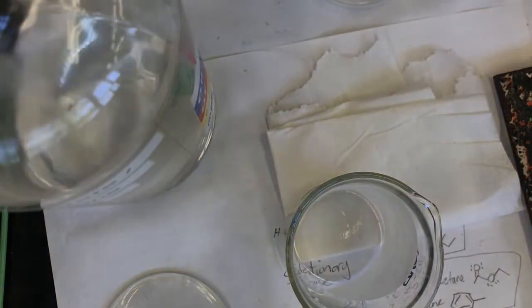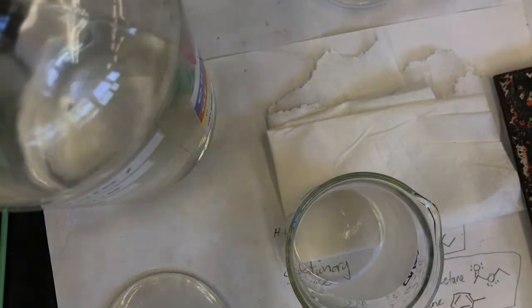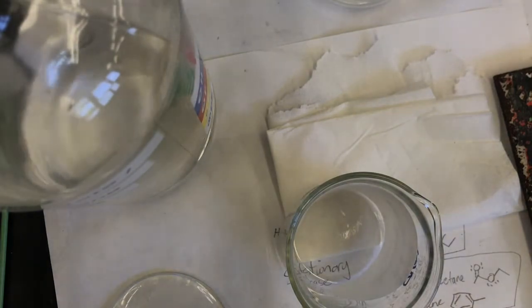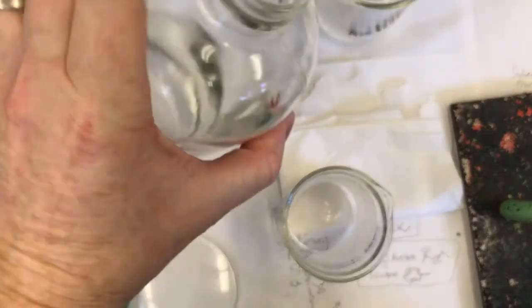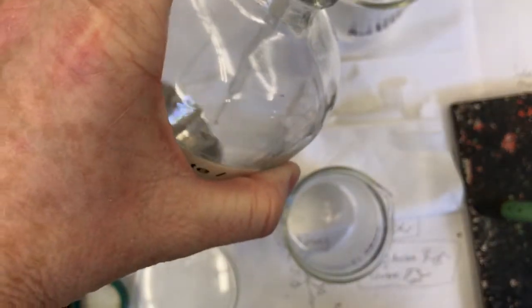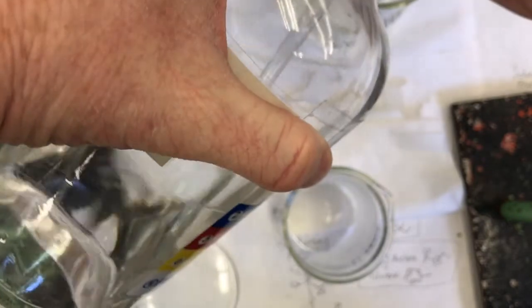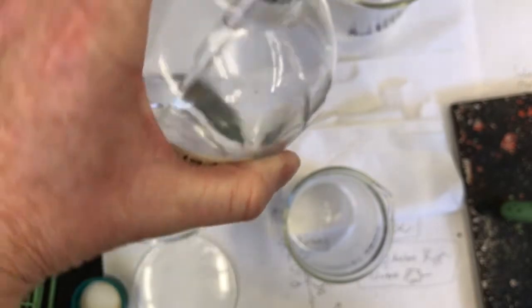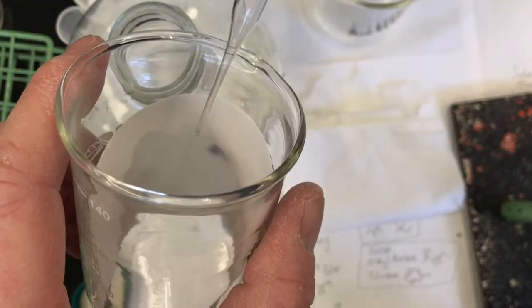Drop the cap. Grab the cap. And pipette some of this solvent in and then spit it out. Do that a couple times to get the pipette evaporatively cooled. And then I can start filling up my beaker.